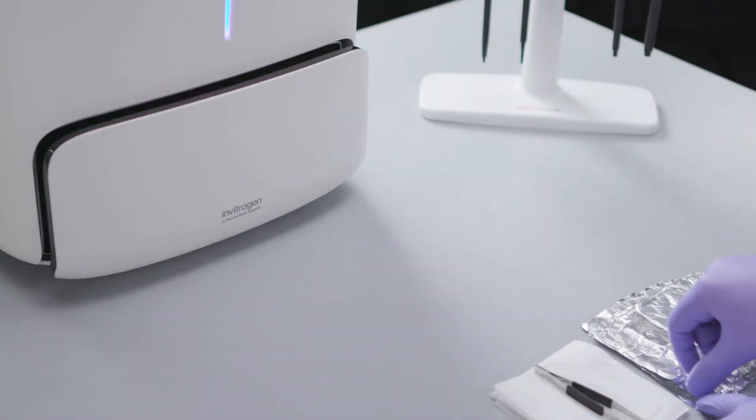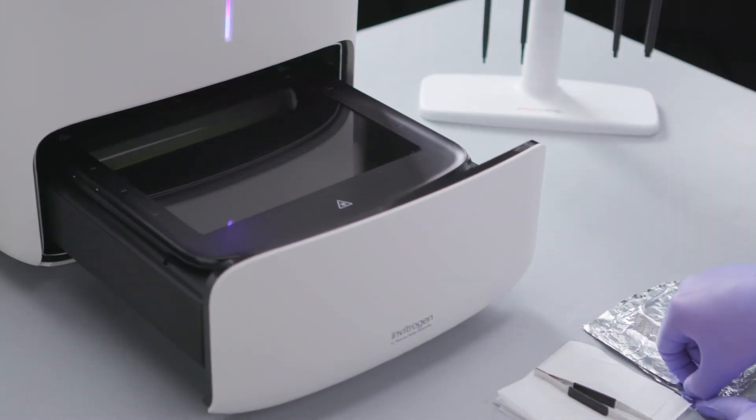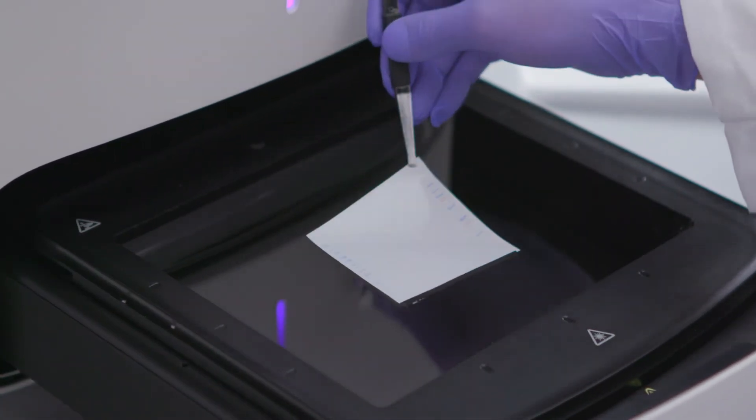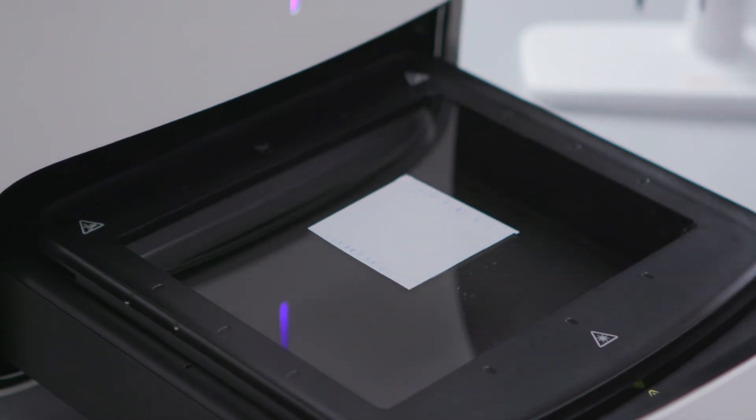Blots can be imaged immediately while still wet or may be dried prior to imaging. Place each blot in a sheet protector or on a clean surface prior to imaging to prevent contamination.